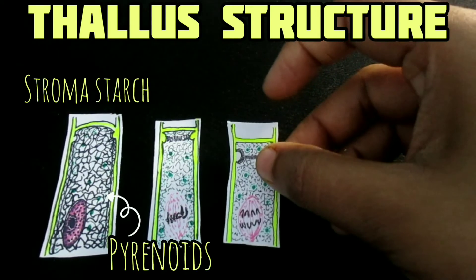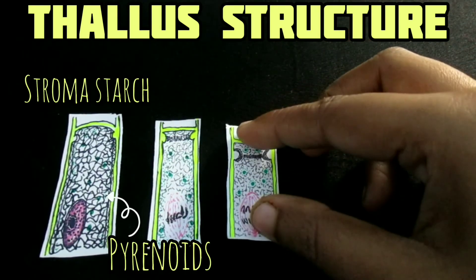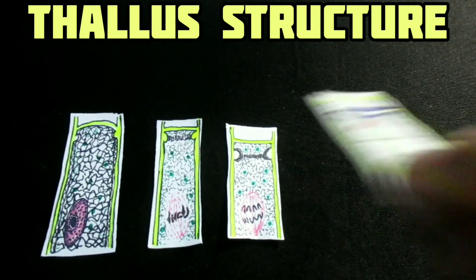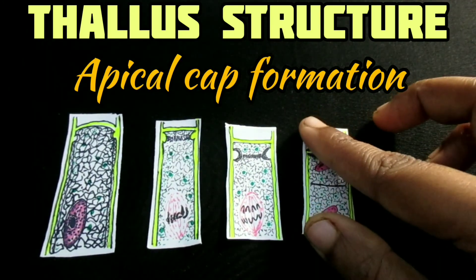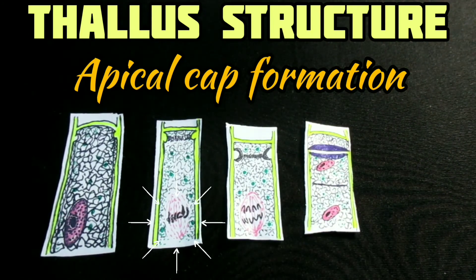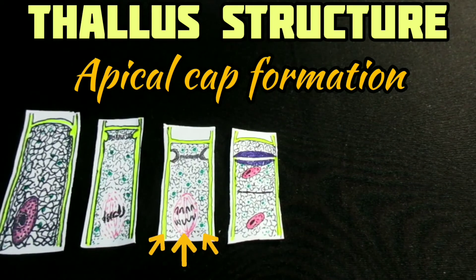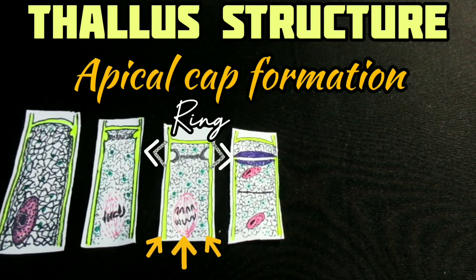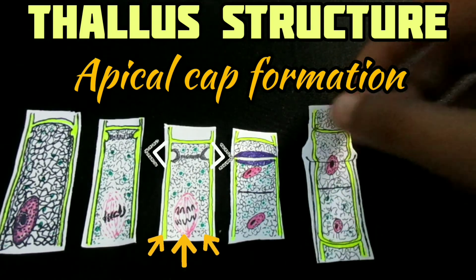These starch granules from the pyrenoids may migrate and accumulate in the strands of the chloroplast net until the reticulate of the chloroplast is totally obscured; such a structure is known as stroma starch. In the mode of cell division resulting in the production of a cap, the nucleus migrates towards the distal end of the cell and cell division starts; the nucleus then divides mitotically.